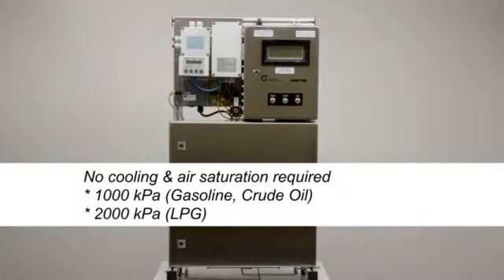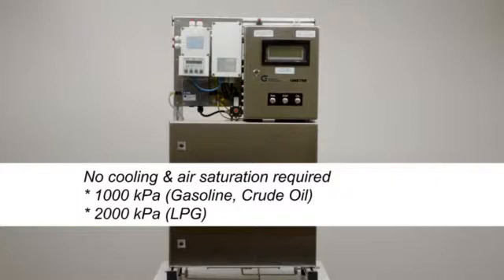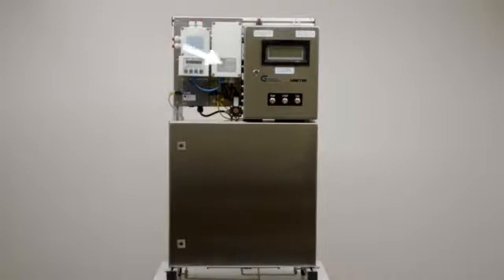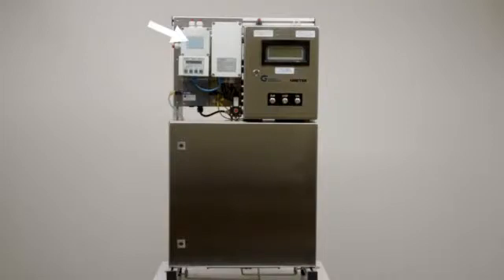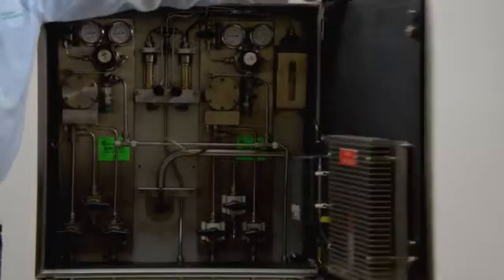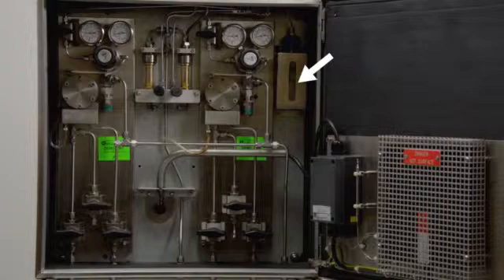Maximum pressure is 1000 kPa for gasoline and crude oil measurements and 2000 kPa for LPG measurements. A fully equipped ATEX certified MINIVAP Online consists of a purge controller and a safety relay switch. In case analog data is transferred, the nitrogen purged measuring cabinet with external controls, a sample conditioning system at the bottom of the analyzer, and the container for the calibration substance.